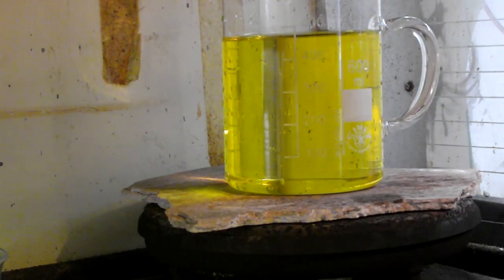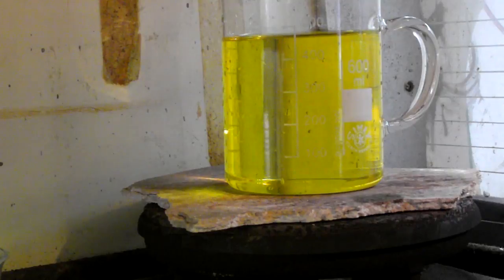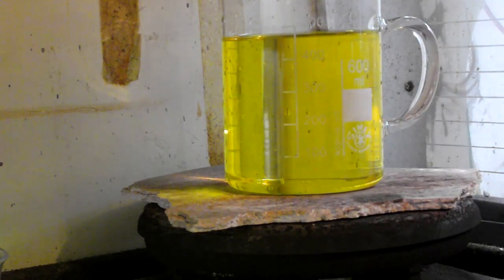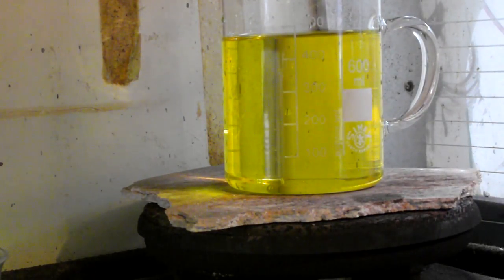Since the addition of oxalic acid produced no visible reaction, I decided that the solution's pH was not high enough, so I added some potassium hydroxide flakes.